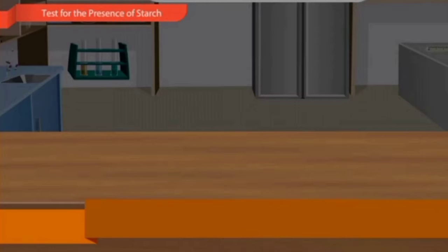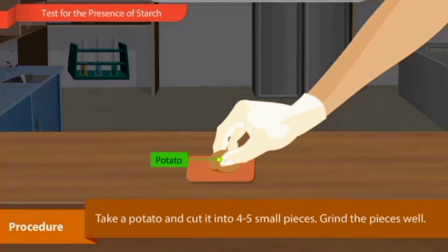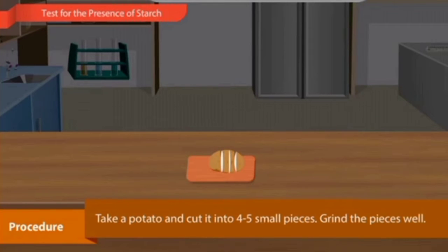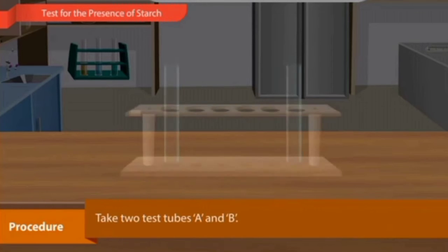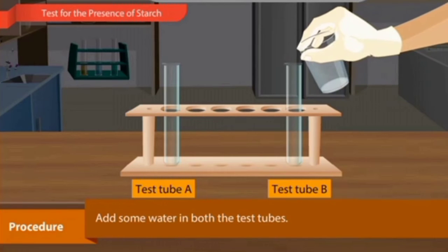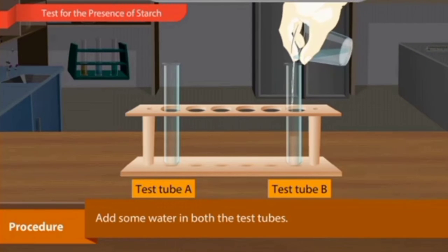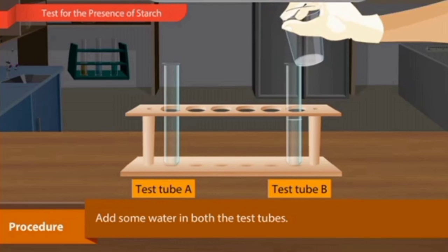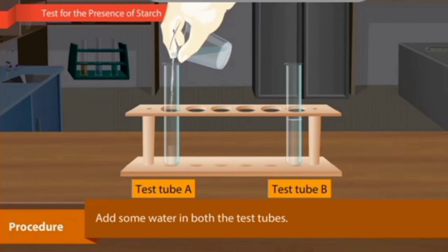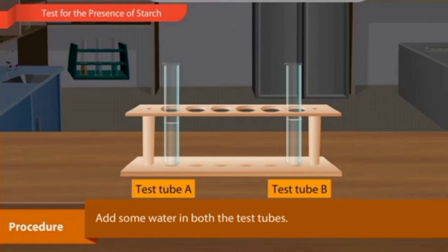So let's perform our procedure. First of all, let's do the test for the presence of starch. The procedure is you have to take a potato and cut it into 4 or 5 small pieces. Grind the pieces well. Then you have to take 2 test tubes, A and B. Add some water in both test tubes, A and B as well.